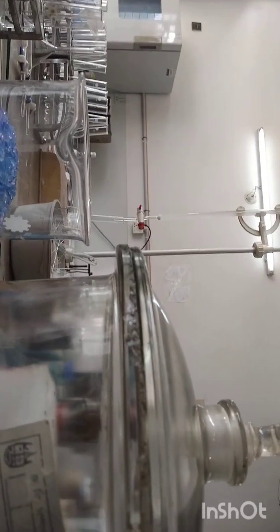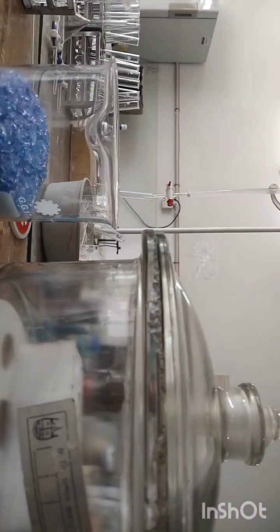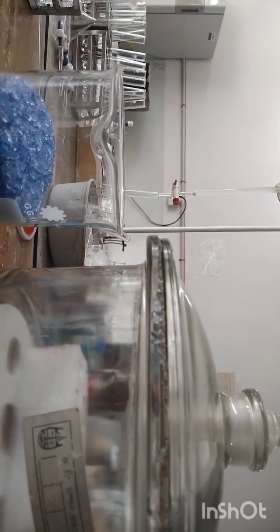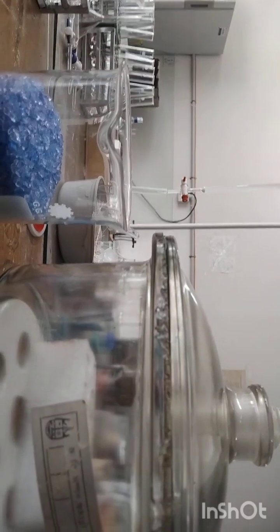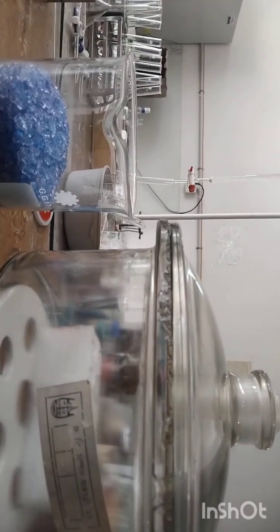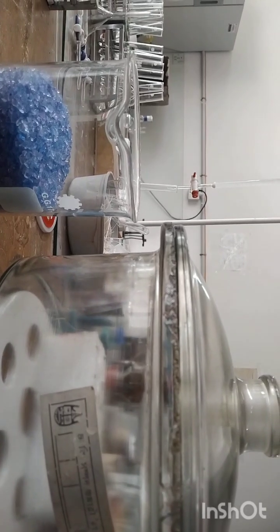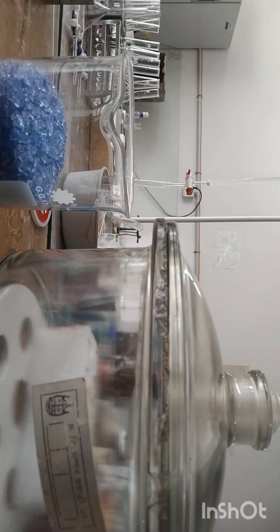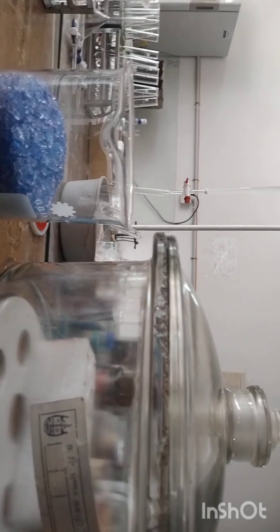And the maintenance tips of this specific apparatus: regularly regenerate or replace desiccants in the lower compartment or bottom compartment, and clean and dry thoroughly after each use. Store in a safe and stable location. And the application portion of this apparatus in the chemistry laboratory: drying solids after filtration or recrystallization, cooling crucibles or beakers in a moisture-free environment, and storage of moisture-sensitive reagents.